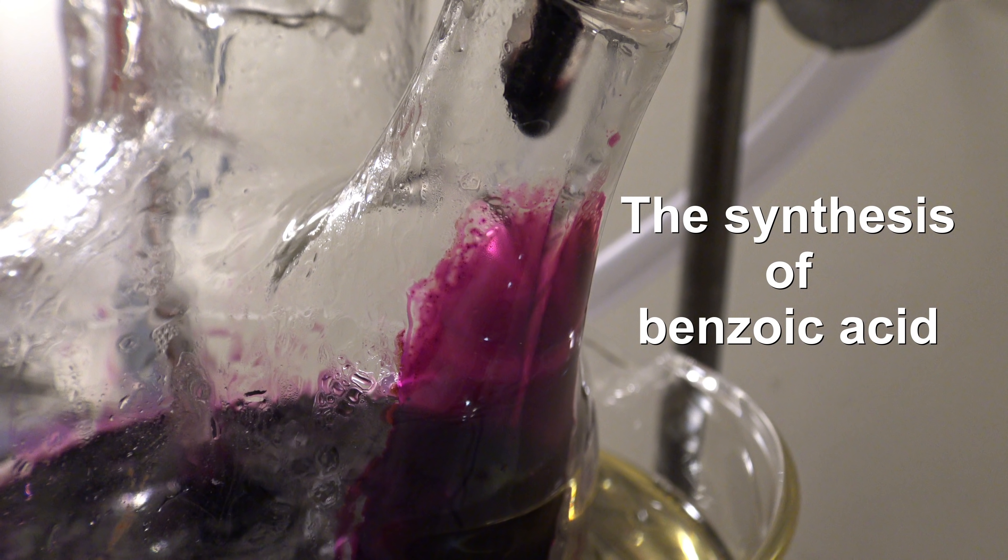The synthesis of benzoic acid. Attention.